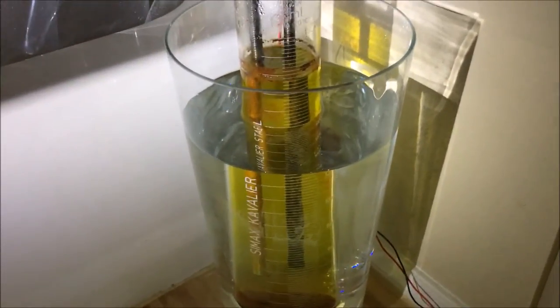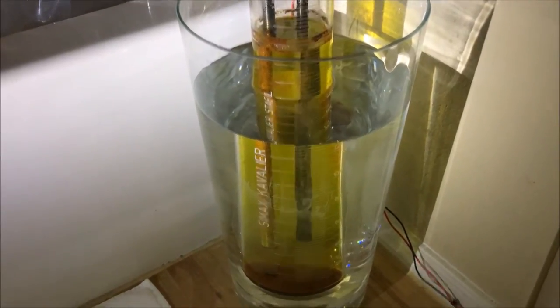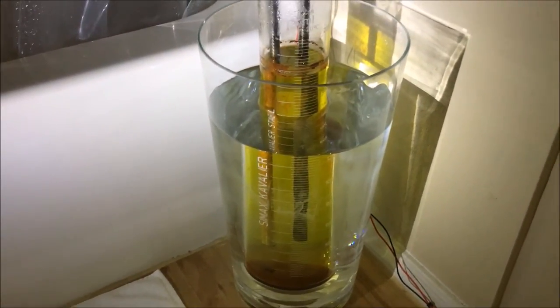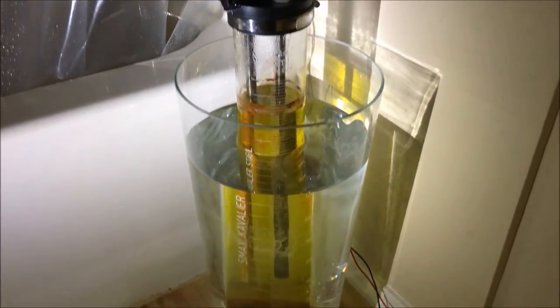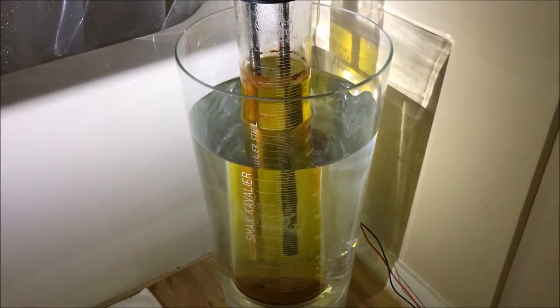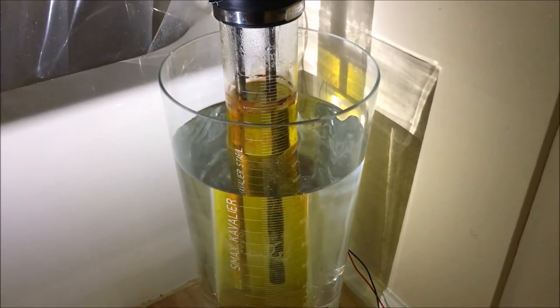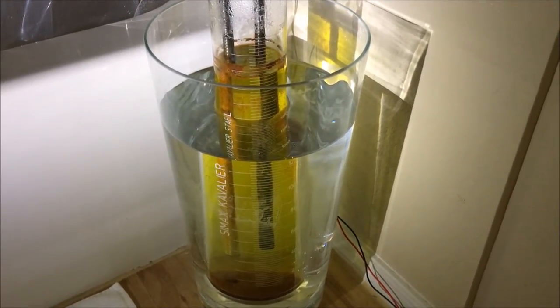Now, as you can see, I have given it my best go. I've tried it a second time, and it still built up this oxide from the anode rod. So I'm going to be shutting this down for now. I may still continue, I may come up with a different design and implement that in a future video, but for now, since I've learned a few things about electrolysis, I'll take them and then hopefully apply them later on in my career if I ever have to consult on something regarding the electrolysis of water.